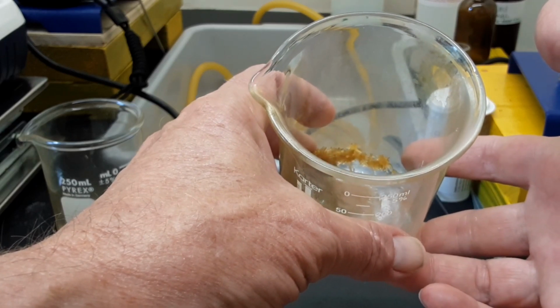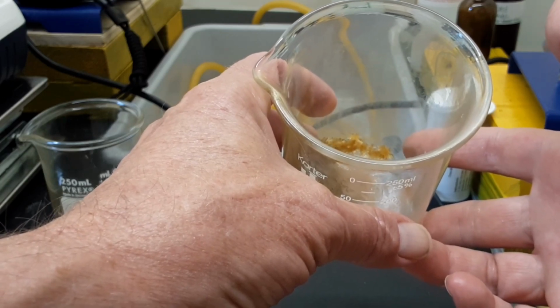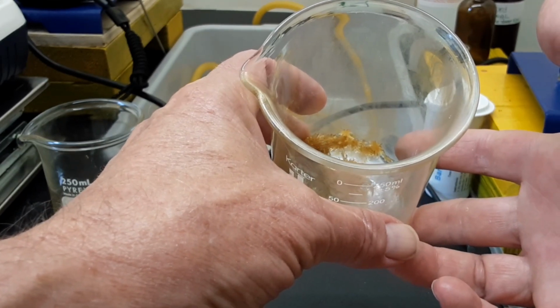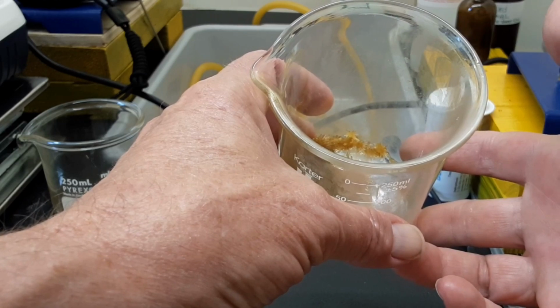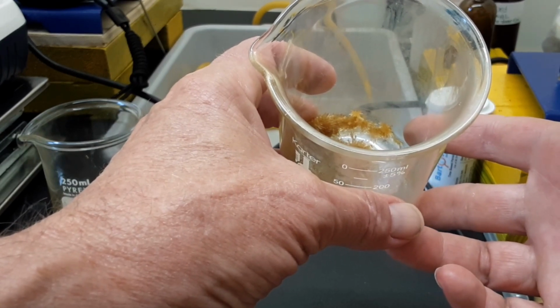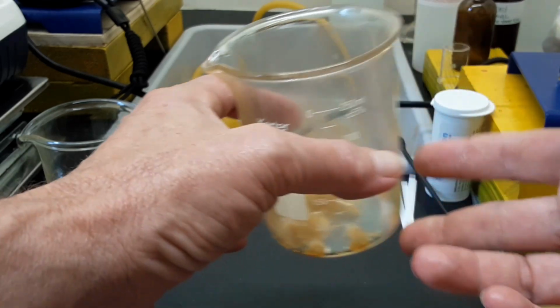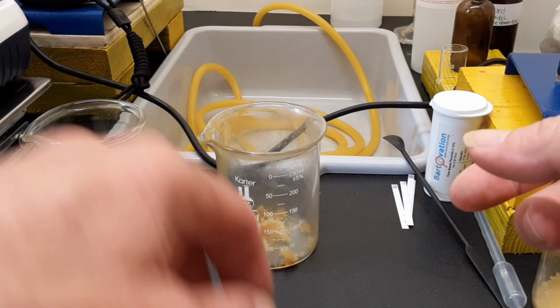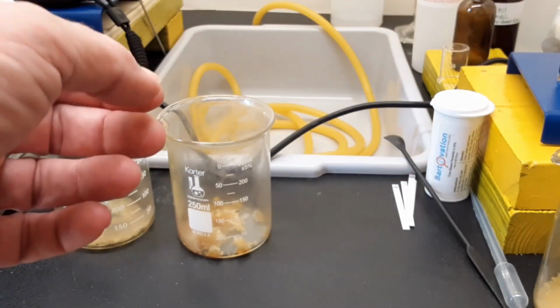And then when I smelled the distillate, 2 different distillates that I had pulled off of it, it had this sweet kind of raunchy smell, which I think most of that was the ethanol and the fact that for some reason my brain doesn't do well with the smell of ethanol. So it had this sweet kind of odor to it. But underneath the sweet odor was this odor of basically a dead body, is really the only way I can describe it. So it was like a mixture of sweet, nauseating kind of dead carcass of some type. Whether or not it had an amine in it, I just don't know. I don't know that I would have said it smelled like fish, the distillate. It was kind of on the ratty edge.